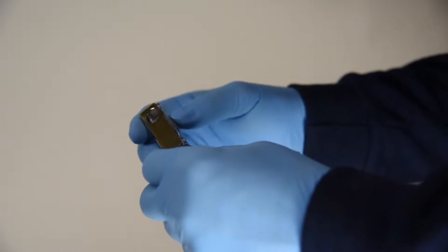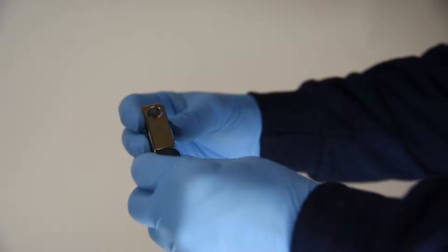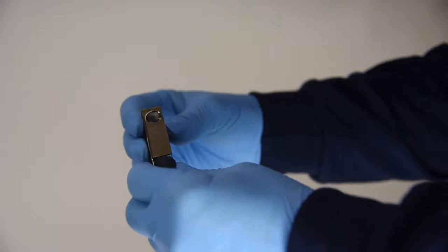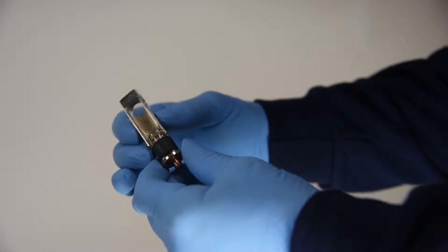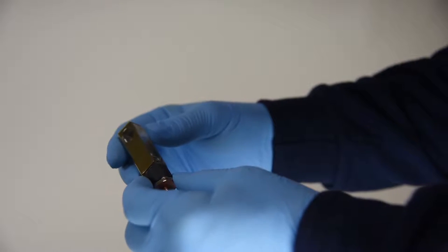So how we made it, it has like a little pinch point. So all you got to do is just squeeze it a little bit, so we have enough force on it, it won't crack the glass.